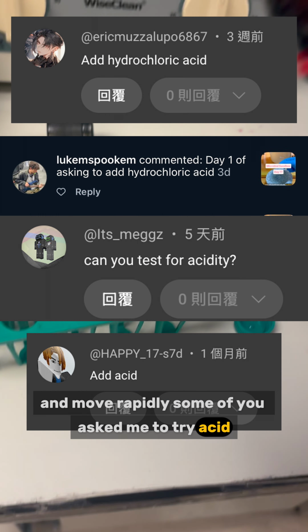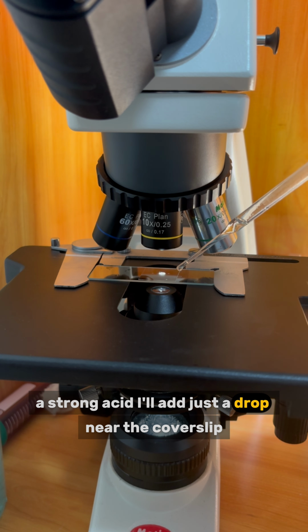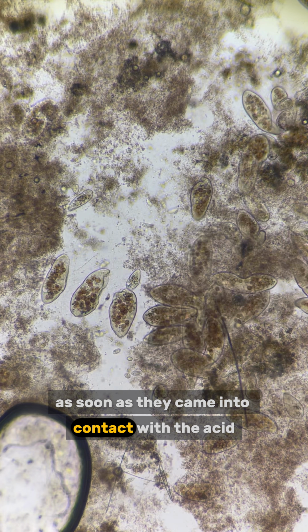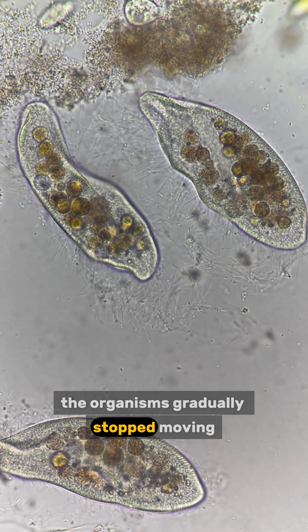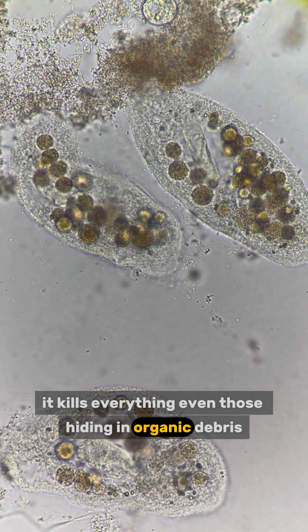Some of you asked me to try acid, so let's test it. I have hydrochloric acid, a strong acid. I'll add just a drop near the cover slip. As soon as they came into contact with the acid, the organisms gradually stopped moving and eventually burst. This acid is too strong. It kills everything, even those hiding in organic debris.